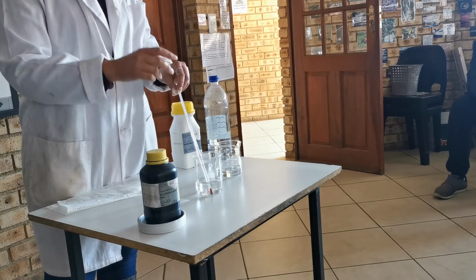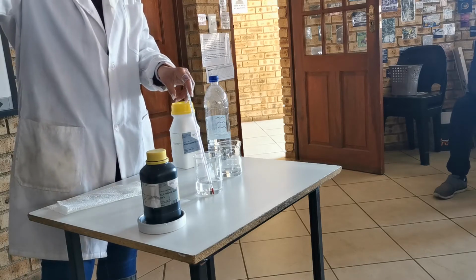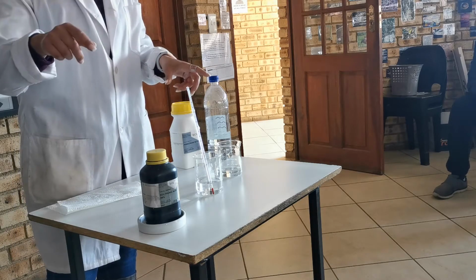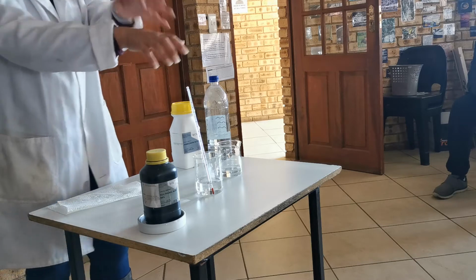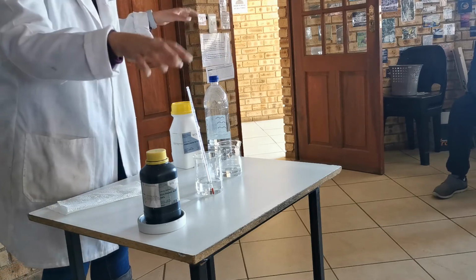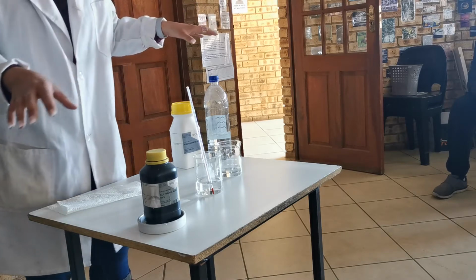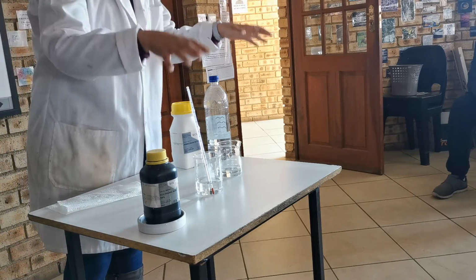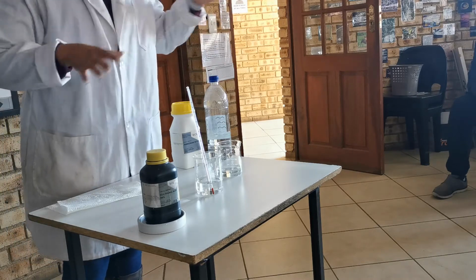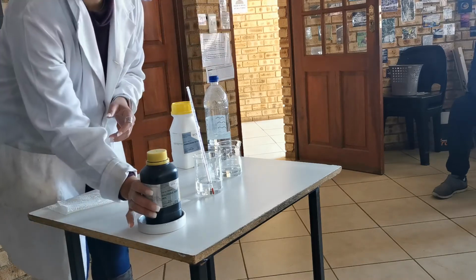That means that you get to a tap before you start screaming. Do you understand? Once you have your hand underneath running water, that is when you're allowed to start being dramatic. You have to spend the first part being smart and getting rinsing happening, and then you can be a drama queen longer. Now, I have my acid.